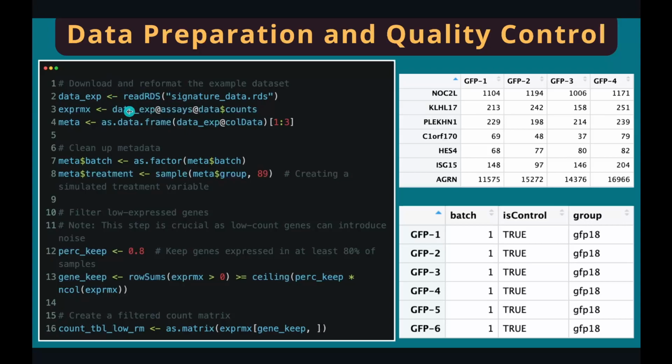And once read in, we can extract the gene expression matrix from the object. You can see the object as folders and subfolders. So we access the subfolders using the @ sign, and there's a subfolder called data, and in the data subfolder there's a data matrix called counts, and this is a gene expression matrix like this one. For the sample information table, we also retrieve it from the R object using the @ sign.